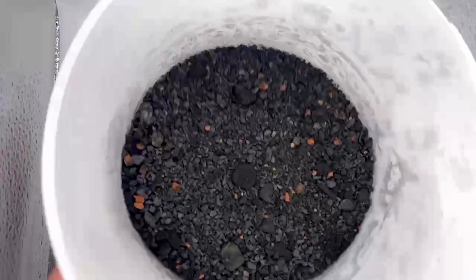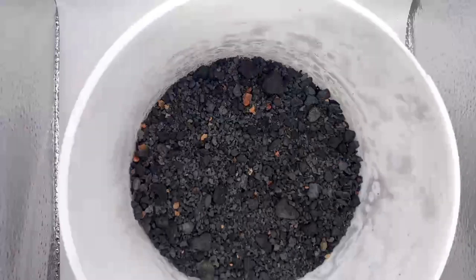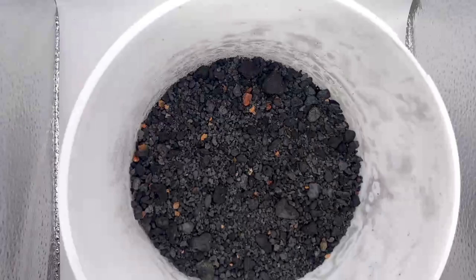On visual inspection here we have a biochar as identified by this dark carbon colour. It's relatively brittle as we can see here. We also have an orange coloured residue that appeared in almost all of the samples. The nature of this orange residue can be identified with some further analysis of the biochar.